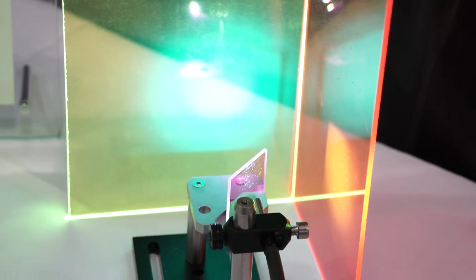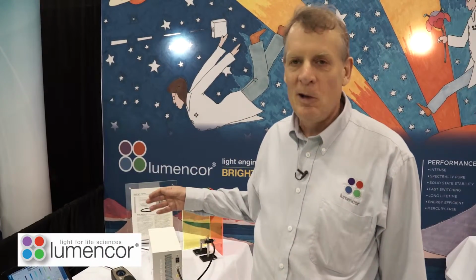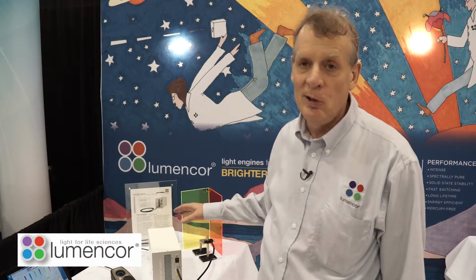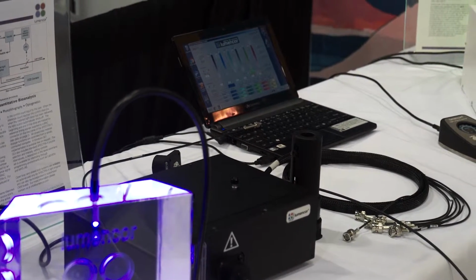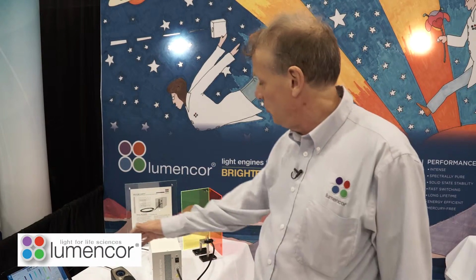One of the features of this is that capacity to switch on and off very rapidly. In fact, a manual control like that is very, very slow compared to the time scales of the experiments that these light engines are used for. In a real experiment, you'd be using a computer that can switch the light source on and off much more rapidly than a human could ever see or do.